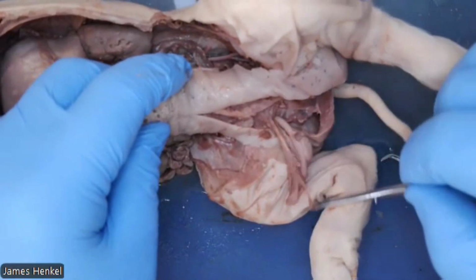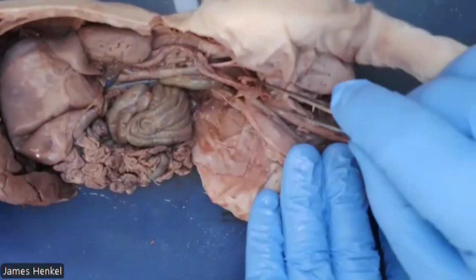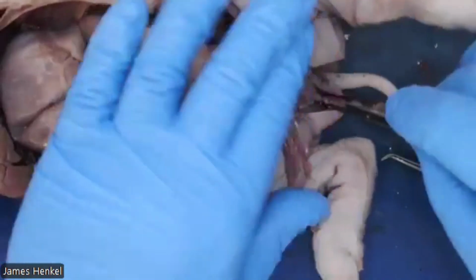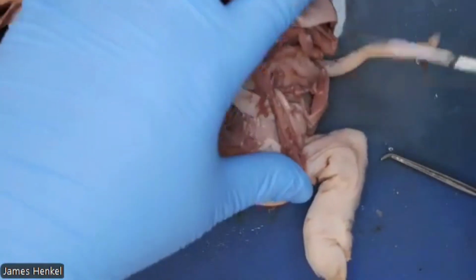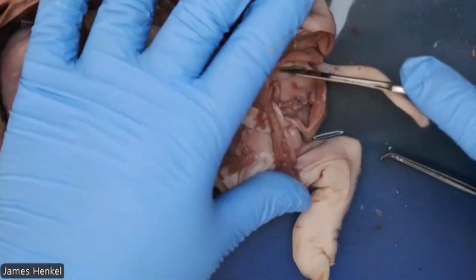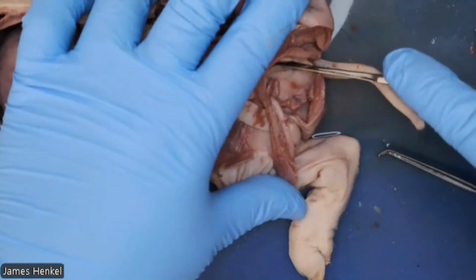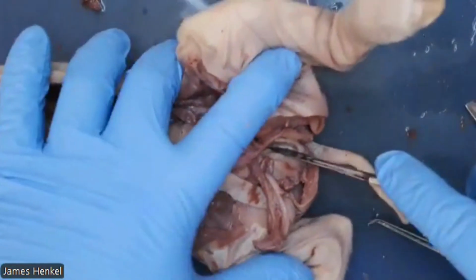This is exactly where we have a vasectomy for males. In humans, they'll cut off both pieces or cut a chunk of it, tie it off, cauterize it to make sure there's no chance of sperm transfer. So those males are artificially sterile.